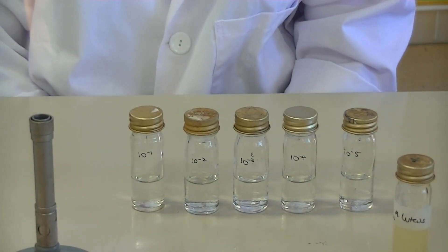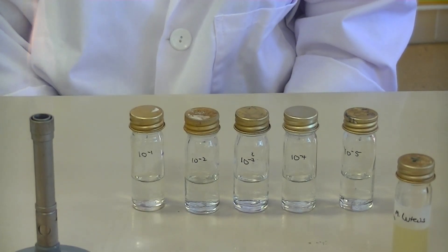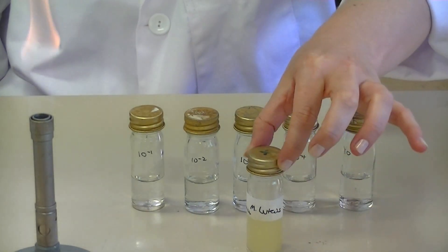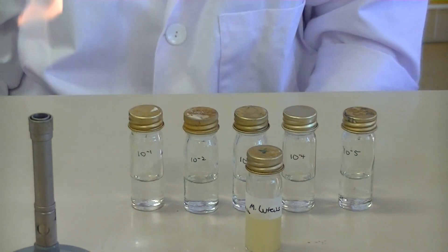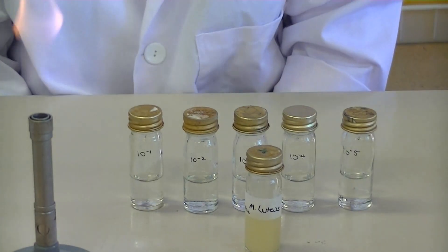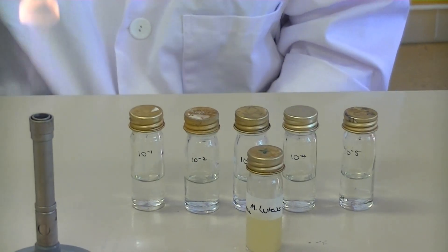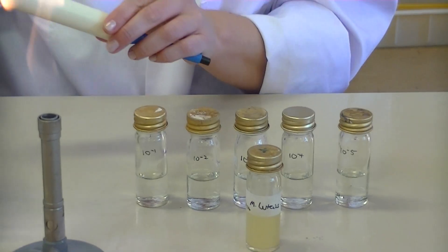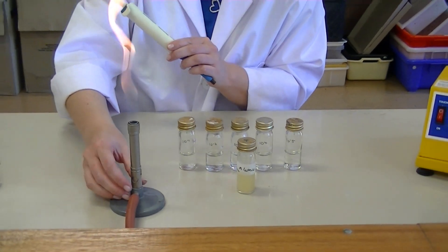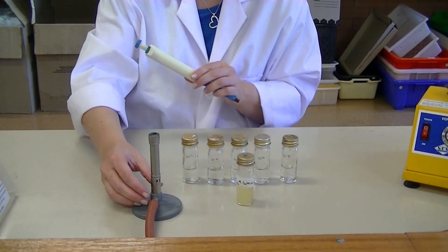If we're performing 1-in-10 dilutions, that means we need to add 1000 microlitres, or 1 mil, of the stock culture to our first tube to create a 1-in-10 dilution, and then serially dilute that into the other bottles using 1 mil. You'll need your pipette, which measures 1000 microlitres, so make sure it's set to the correct volume and the Bunsen flame is on the blue flame.